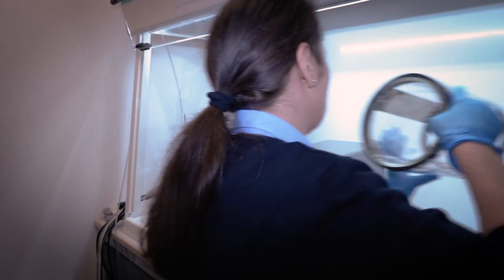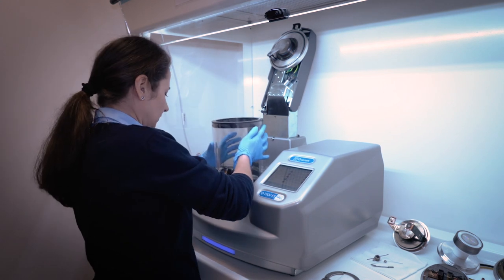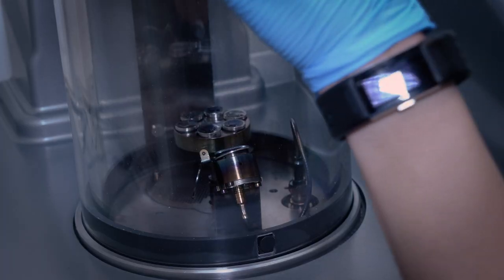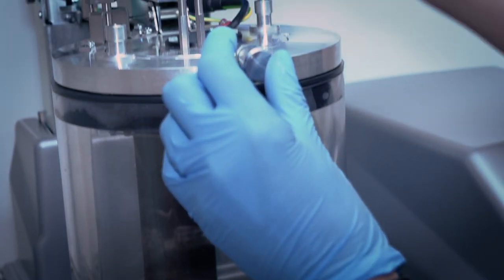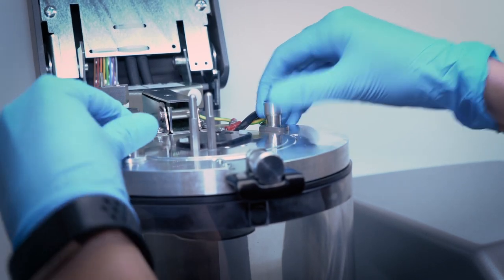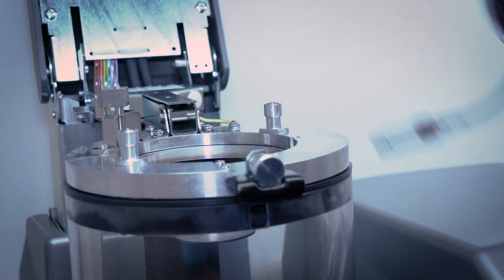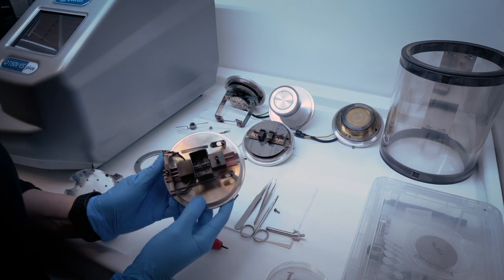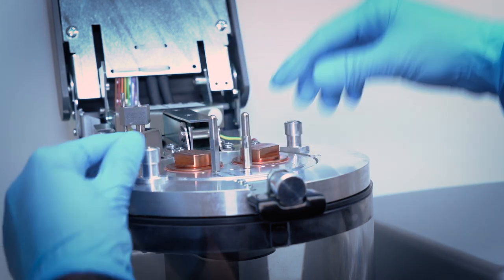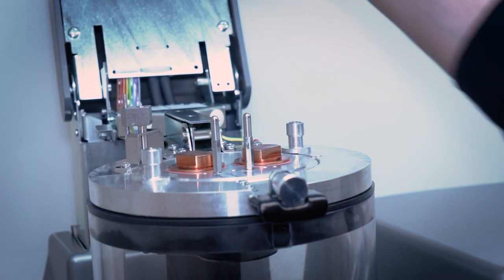For depositing carbon, the tall chamber cylinder was mounted. To change the head for carbon evaporation, we only need to open the top lid, disengage the safety locks and remove the sputtering head. Instead, the carbon rod evaporation head will be put in. It is already fitted with sharpened rods. Now we are ready to run carbon rod evaporation.